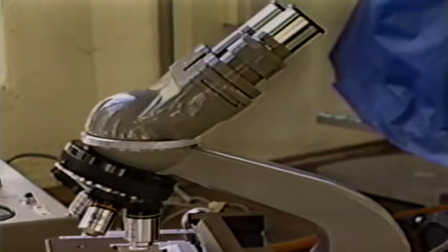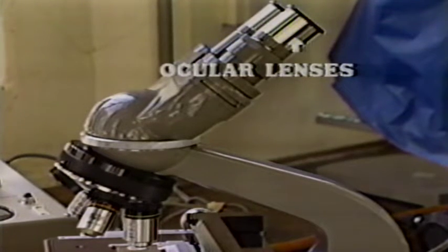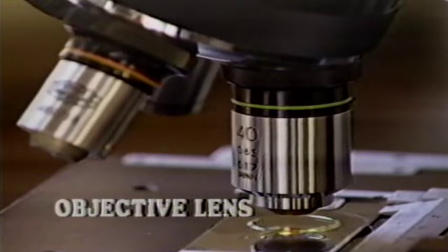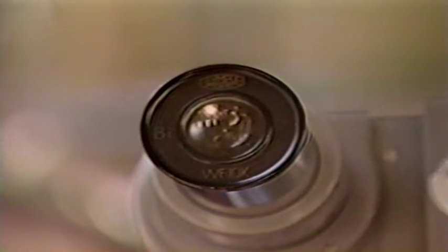At the top of the body tube are eyepieces or oculars, which contain the lenses which magnify the image produced by the objective lens. This instrument has two eyepieces and is called a binocular microscope. Many student microscopes have only a single ocular and are known as monocular microscopes.